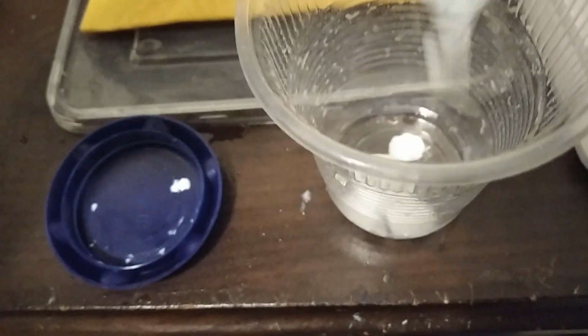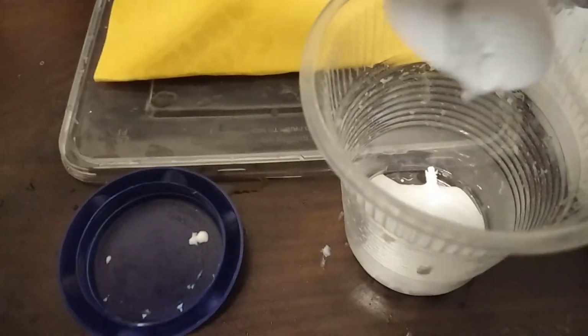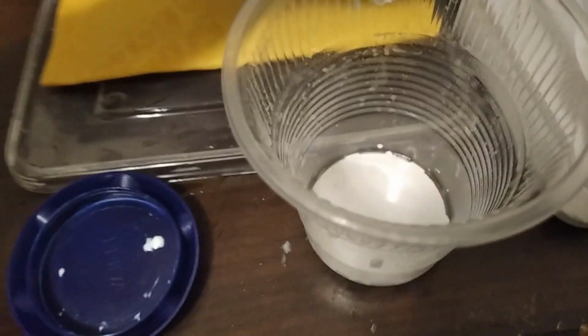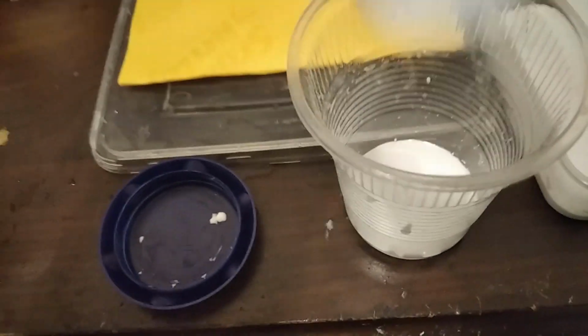Now we take the sodium hydrogen terephthalate. The sodium hydrogen terephthalate allows for the membrane's activity. It allows the ions to pass through. Now this membrane is a cation exchange membrane because we are going to put all of our starting material in the anode compartment. So we only need them to flow to the other side because we're going to exchange the sodium and potassium ions for the copper. So therefore it is a cationic exchange membrane we make.